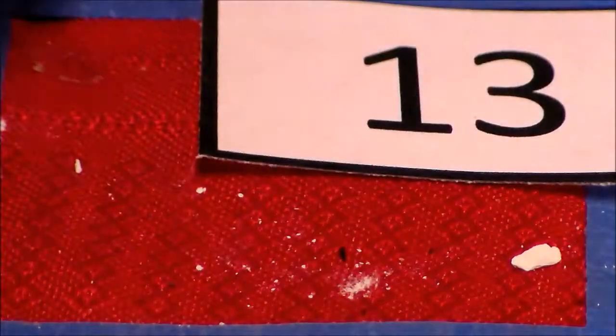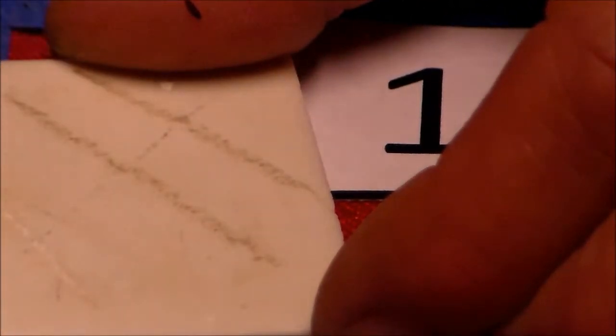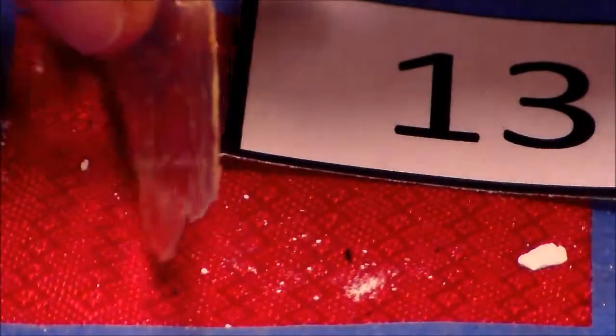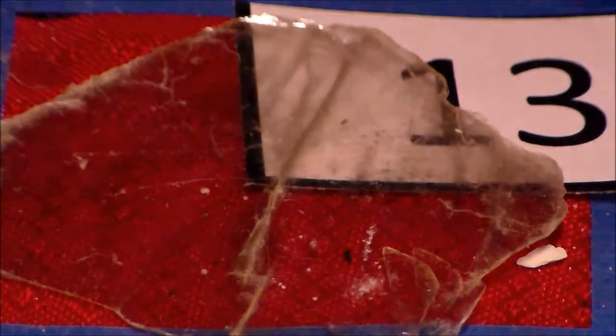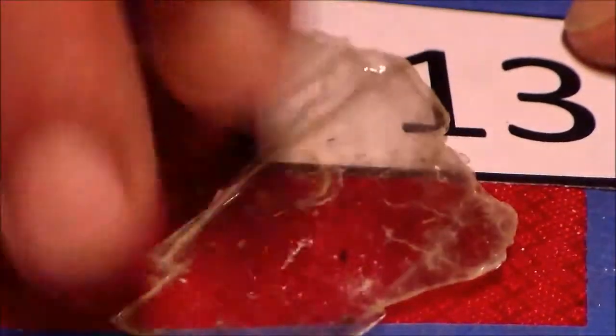And if I can get it to streak for you, it has kind of a white, clear streak to it. We can look at the other properties and see that it flakes, again, into sheets very easily, much like another mica we looked at. It has a very silvery sheen to it. And those should be enough properties to help you name this sample 13.